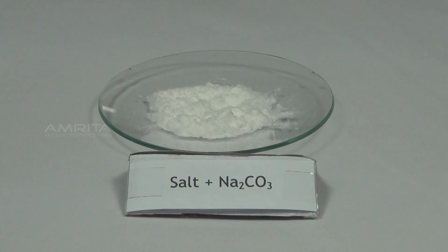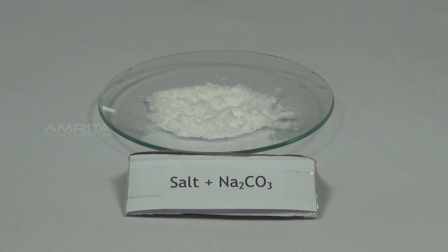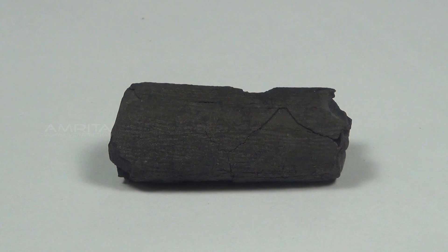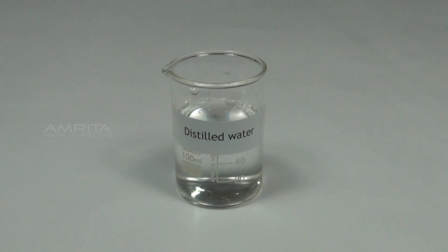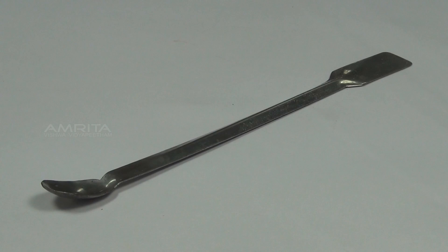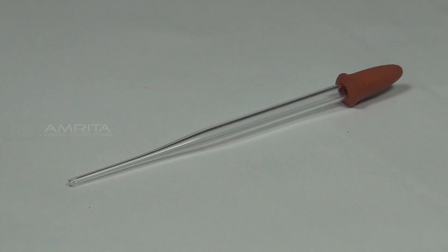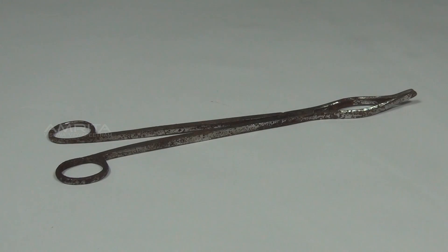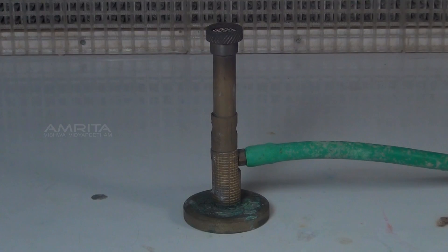Charcoal Cavity Test. Materials required: mixture of salt and sodium carbonate in a watch glass, charcoal piece, distilled water, spatula, dropper, tongs, blow pipe, and Bunsen burner.